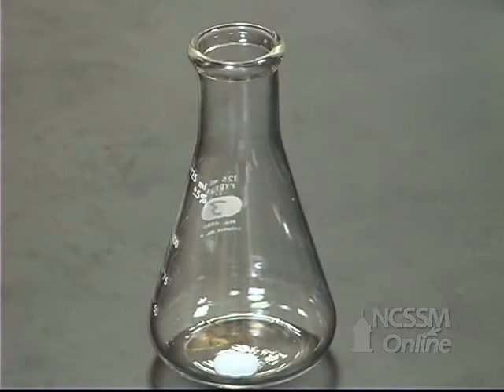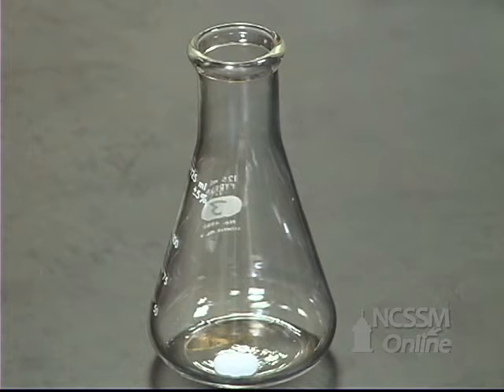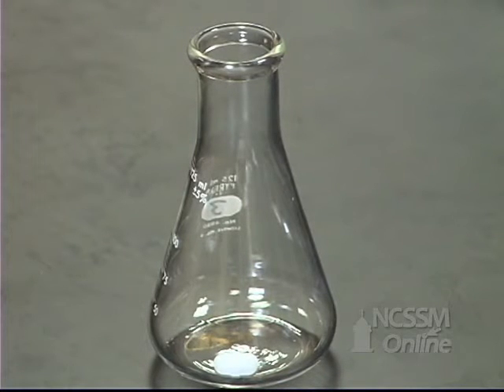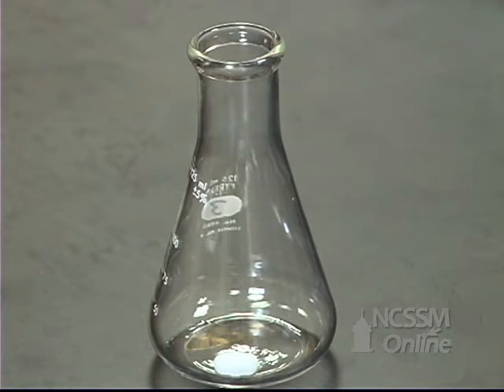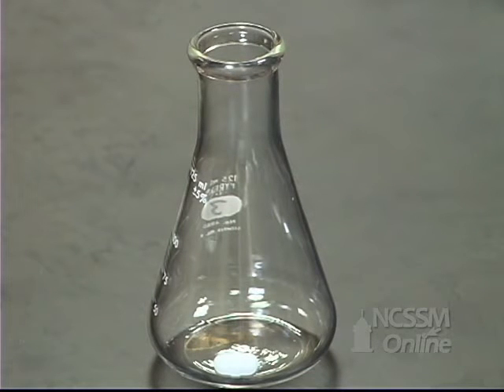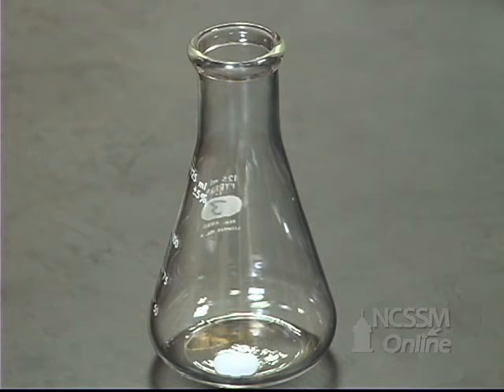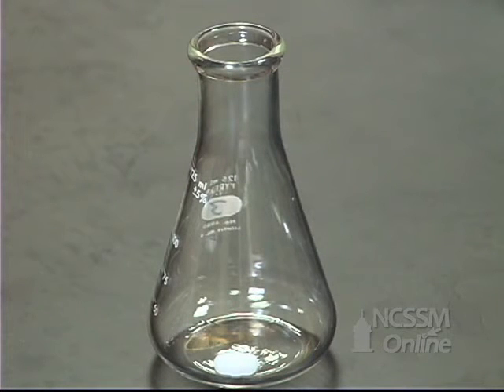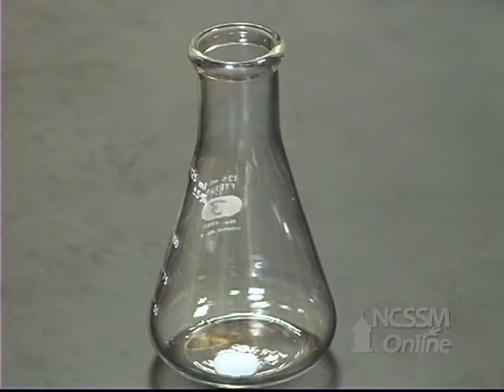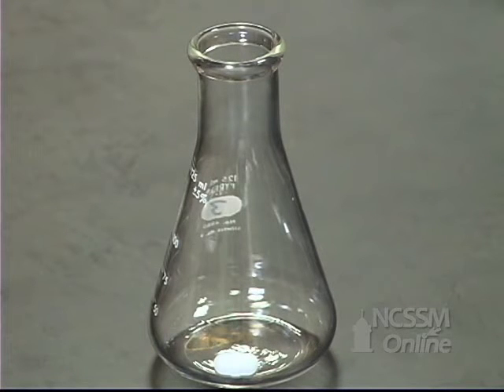We're now going to look at the molar solubility of calcium hydroxide in a solution containing calcium chloride as an example of the common ion effect. We're going to pipette 25 mL of a saturated solution of calcium hydroxide in a solution containing calcium chloride.